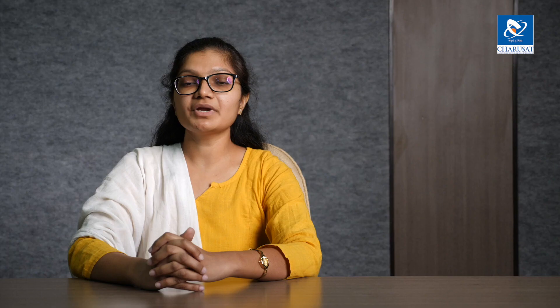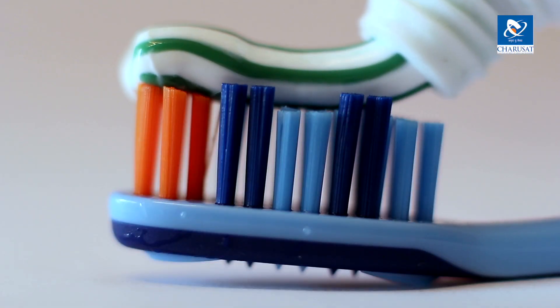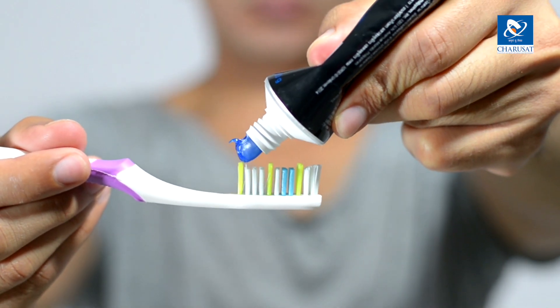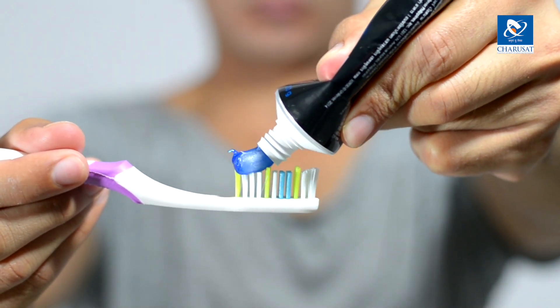This is often a requirement of industry people. For example, toothpaste is a shear thinning material. When we apply shear, the viscosity of toothpaste reduces. So the manufacturer must be aware of the flow property of toothpaste before manufacturing it in bulk. When a consumer presses the tube gently, a small amount of toothpaste comes out — this is taken care of by rheological characterization.